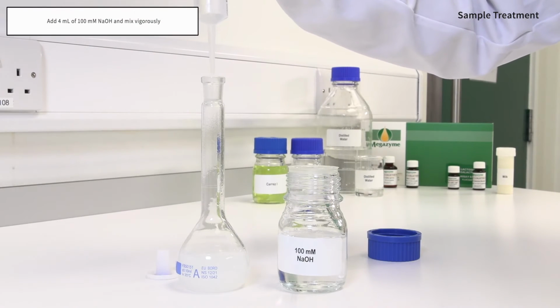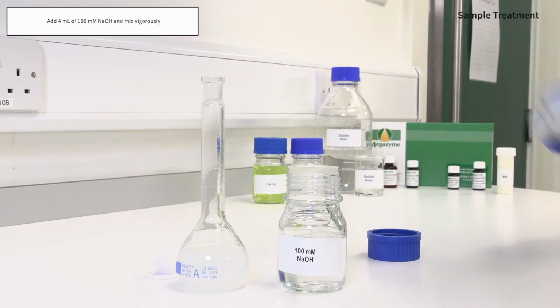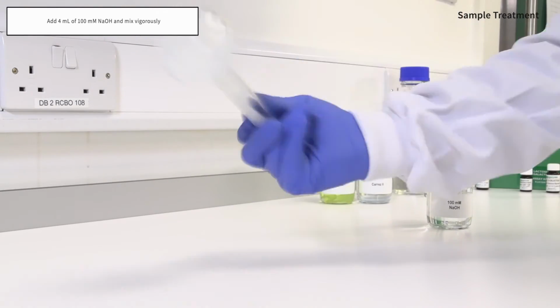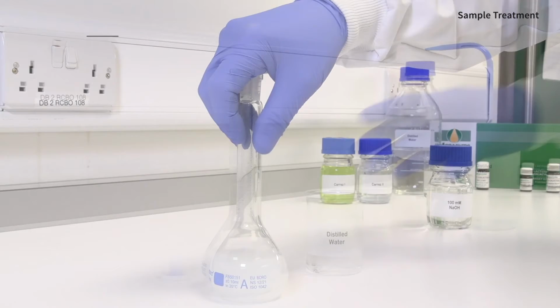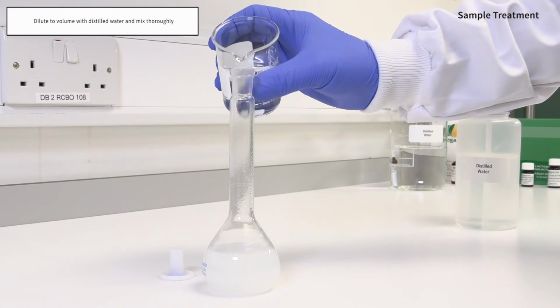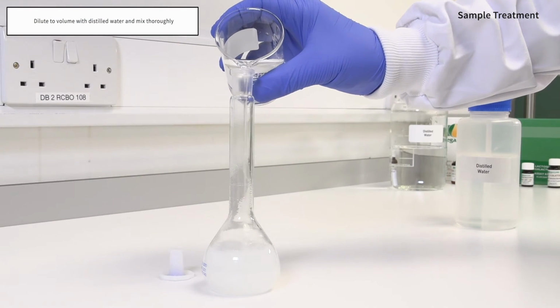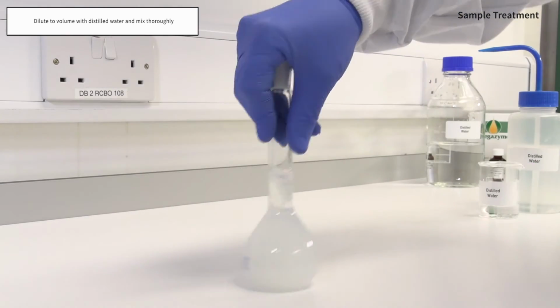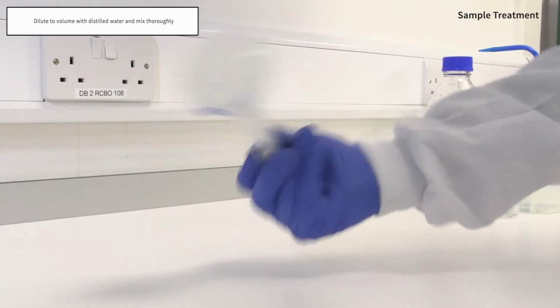Add 4 ml of 100 millimolar sodium hydroxide and mix vigorously. Dilute volume with distilled water and mix thoroughly.